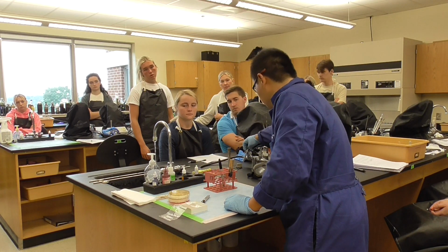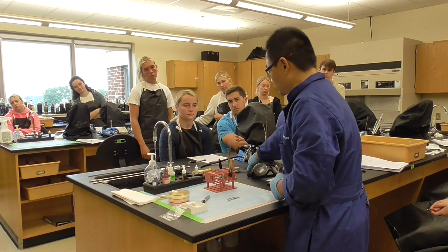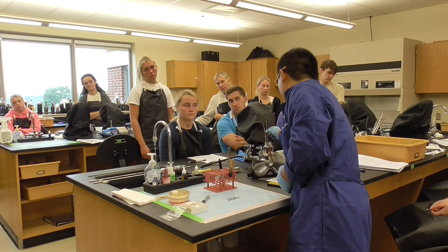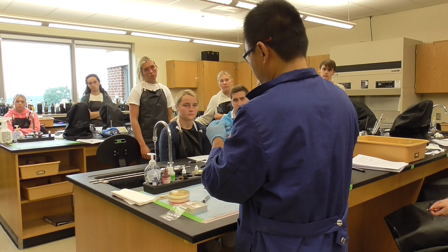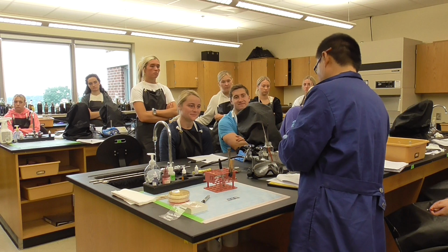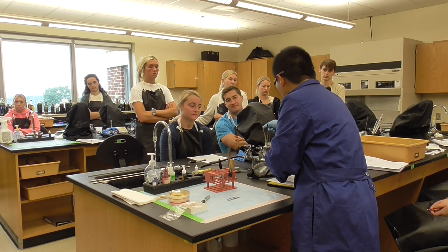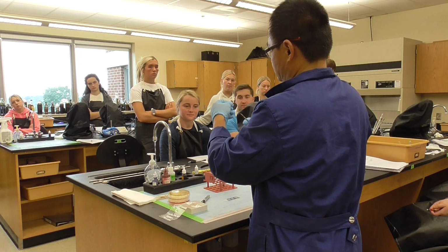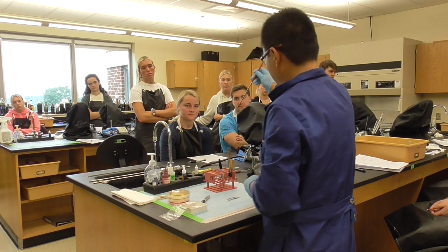Now we're going to turn on the fire, the Bunsen burner. It works, and then you're going to have a loop. So make sure the loop is straight. You see, it's broken. So never mind, we'll just trim it out. I'm going to use this one. Be straight. Okay.